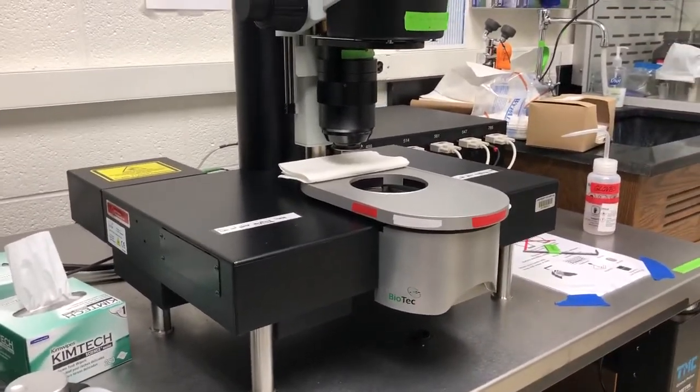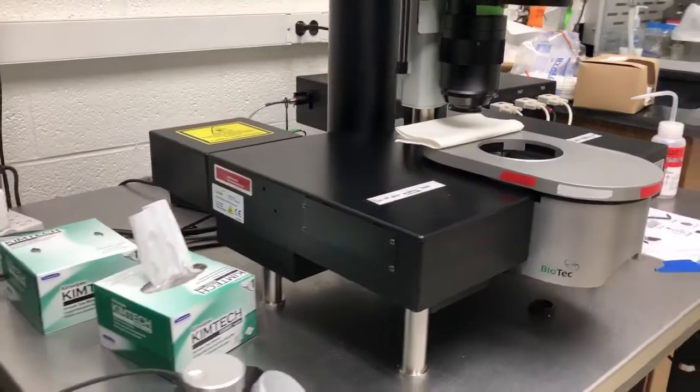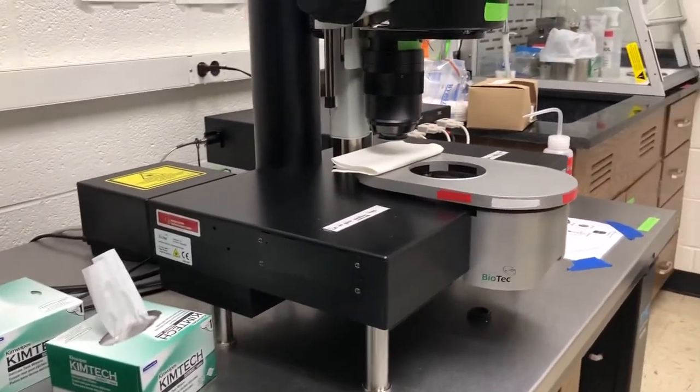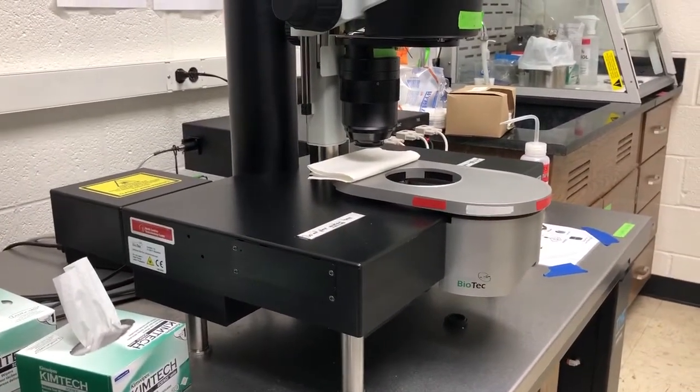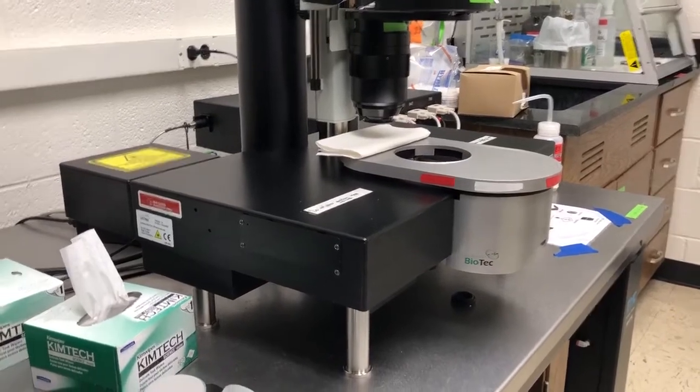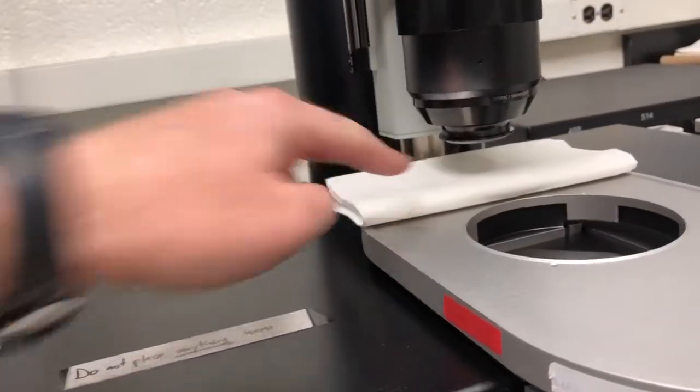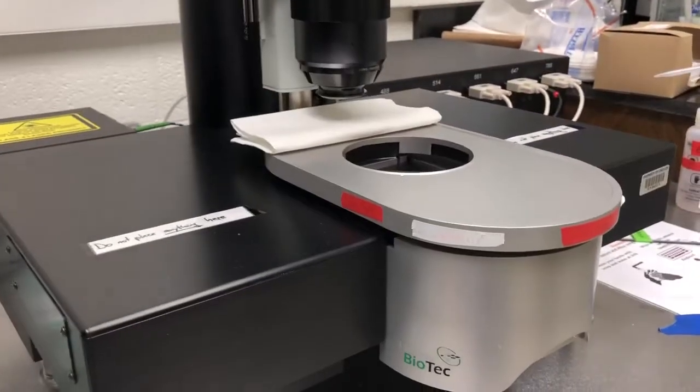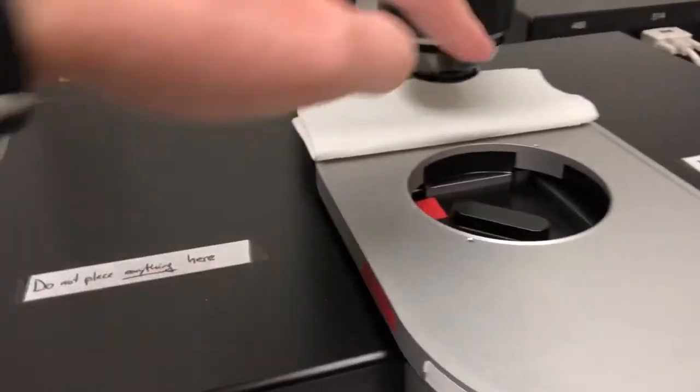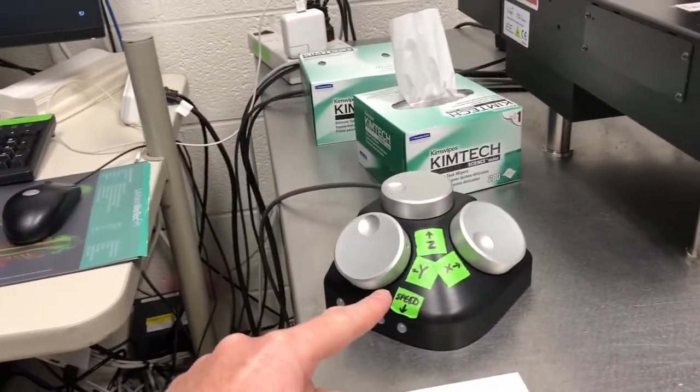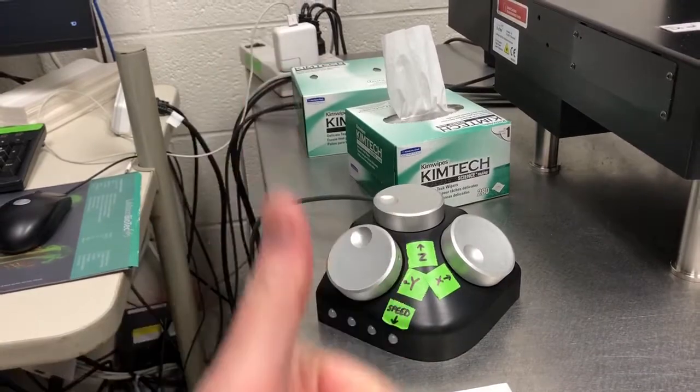What other risks are there to utilizing the system? The other main risk in this system's operation is crashing the objective—the front face of the objective here—into the sample. Remember, the sample is going to be suspended here, and you'll see that later.